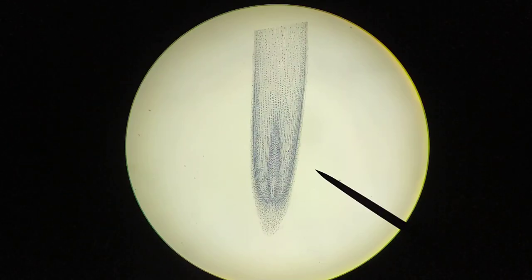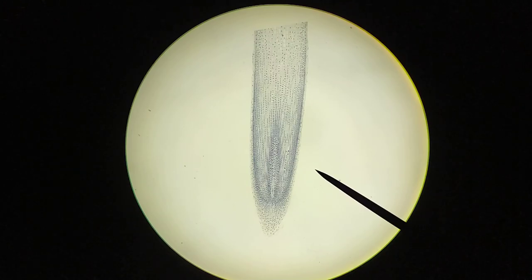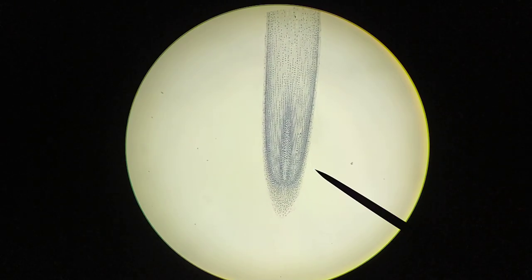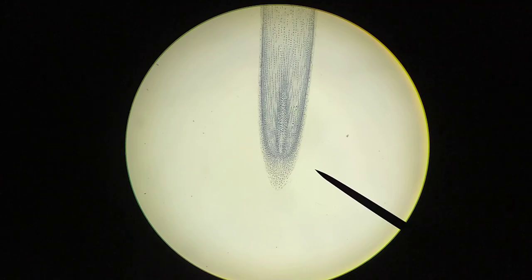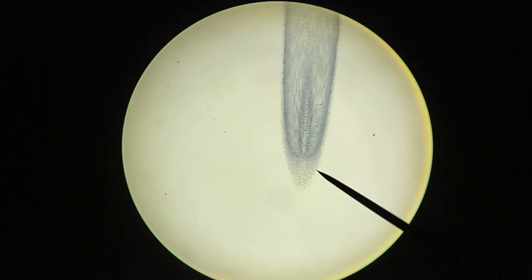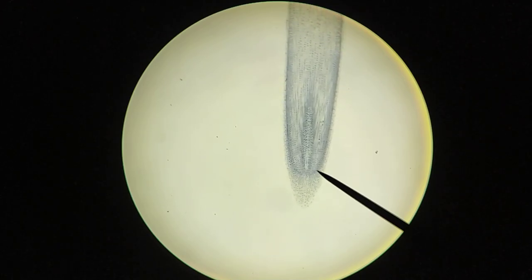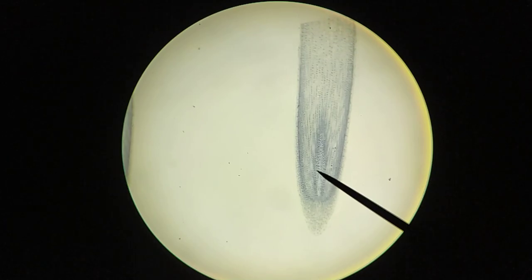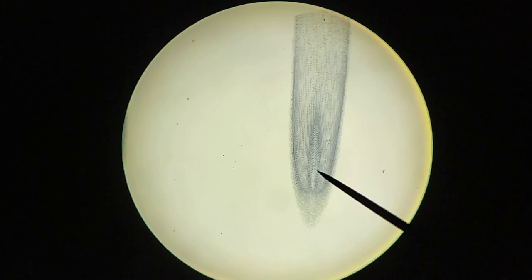Hello everyone. In this video I'd like to give you a quick overview of mitosis as it would be seen on a microscopy slide in onion root tips. We're dealing with plant cells. I'm looking at a root tip here. When a plant is growing its roots, those roots have to push through soil, so a typical root has a root cap, which is clearly visible here. This part at the pointer is the root cap - you can see it's very different in staining characteristics compared to the more cellular part, which is the root apical meristem, where you would find cell division going on.